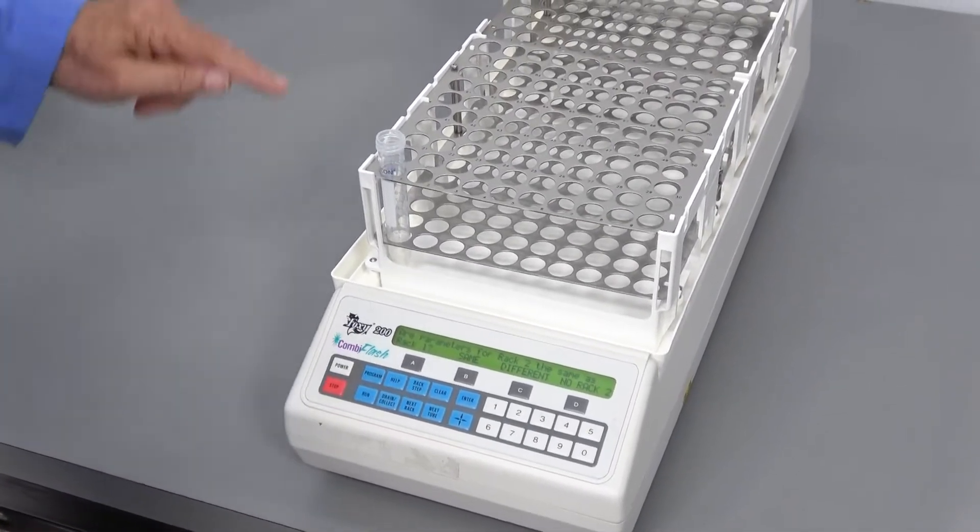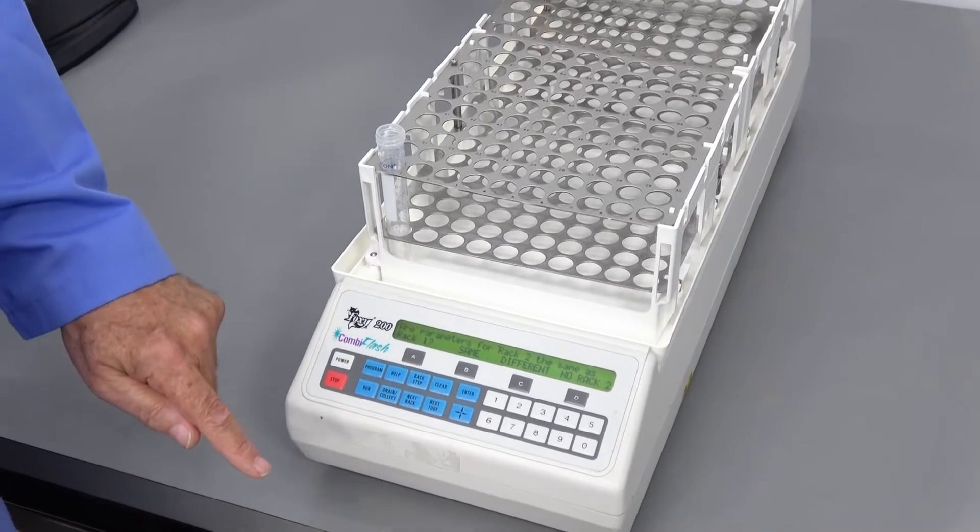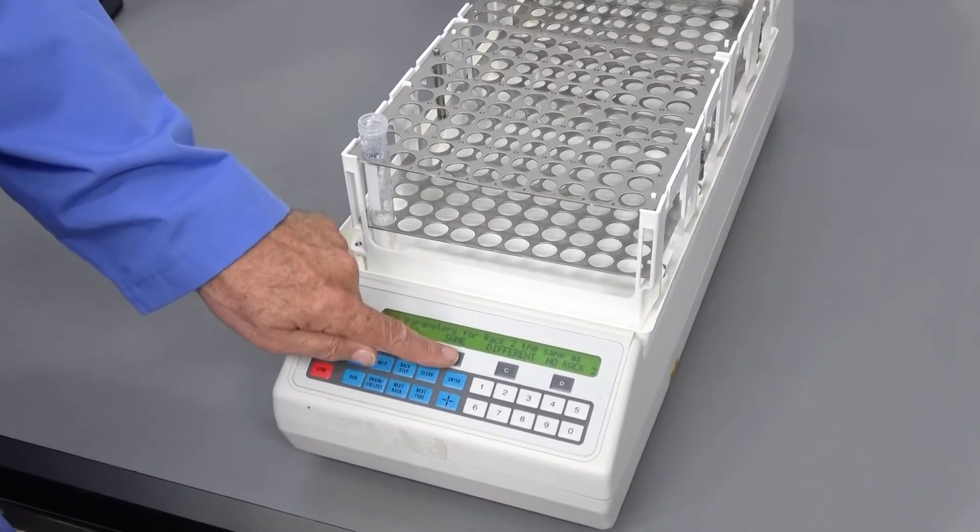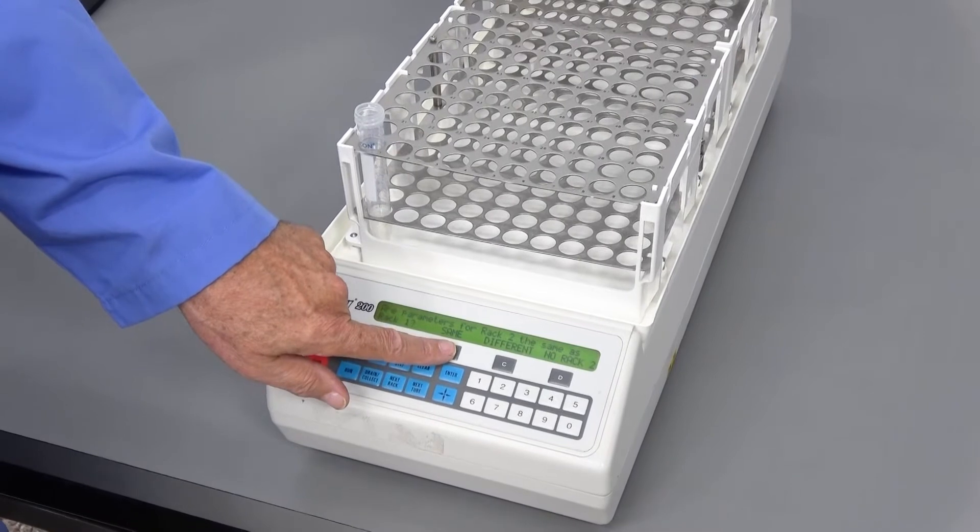And it's asking if we want the second rack to be treated the same as the first or differently. Let's say it's the same.